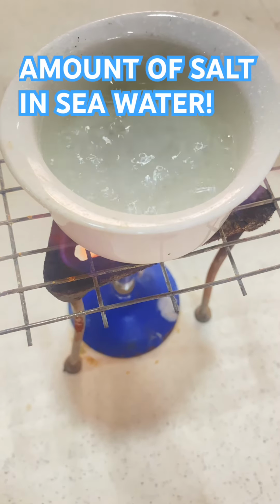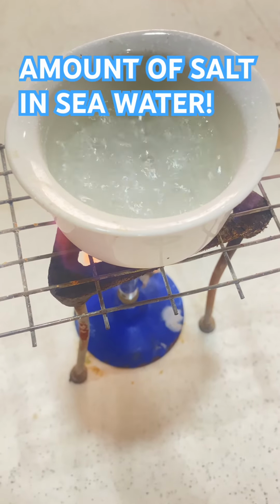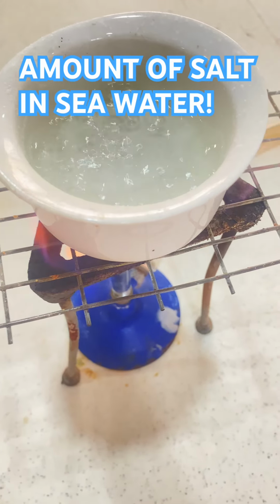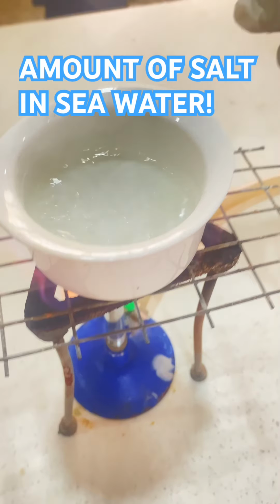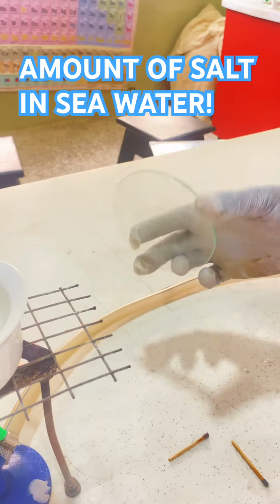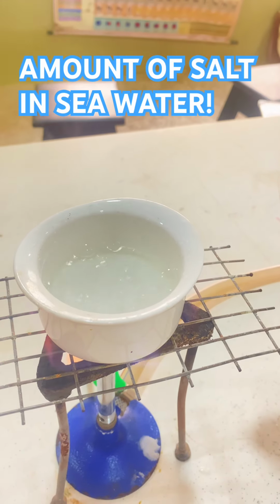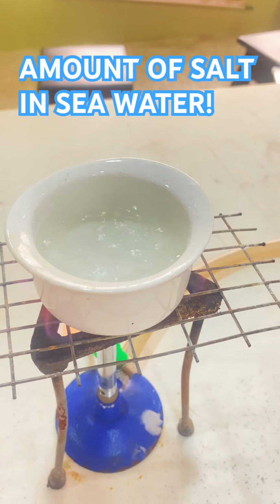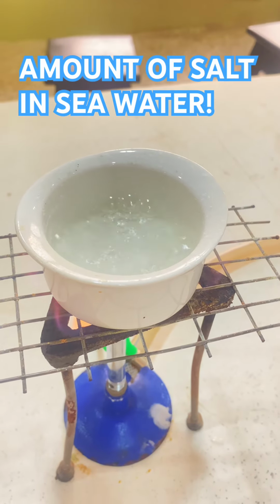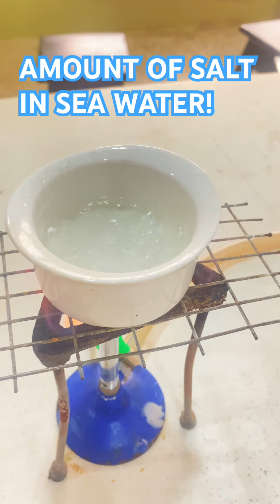You have to be very careful because when the salt starts forming, it will start to shoot up. When it starts to shoot up, you have to make sure that you collect it with the petri dish. This is the petri dish that you can use to block the salt from escaping. Now we can see that the salt is forming from the solution. Now the condensed water, we can just condense it like this to get the water, but we want it to evaporate.